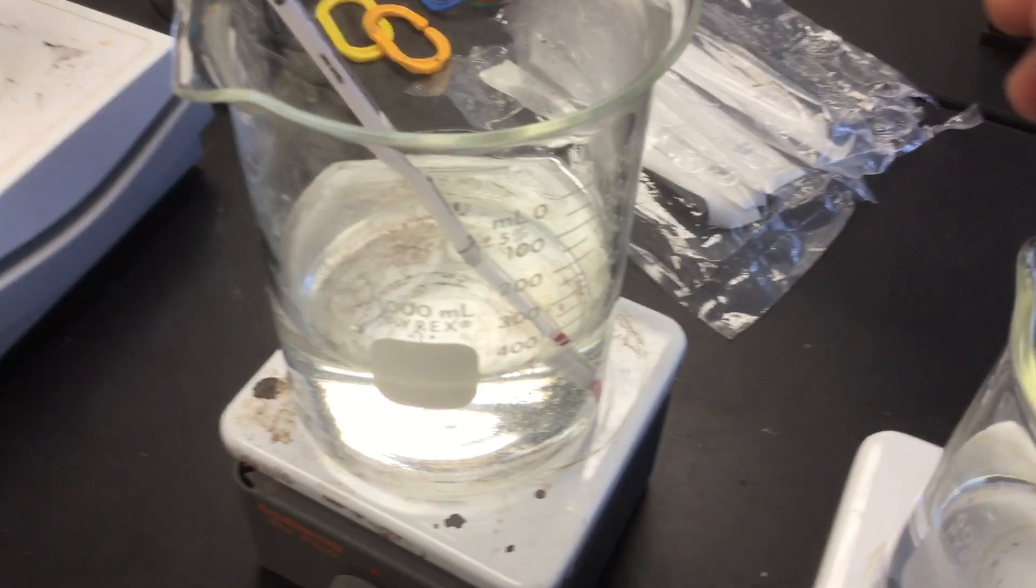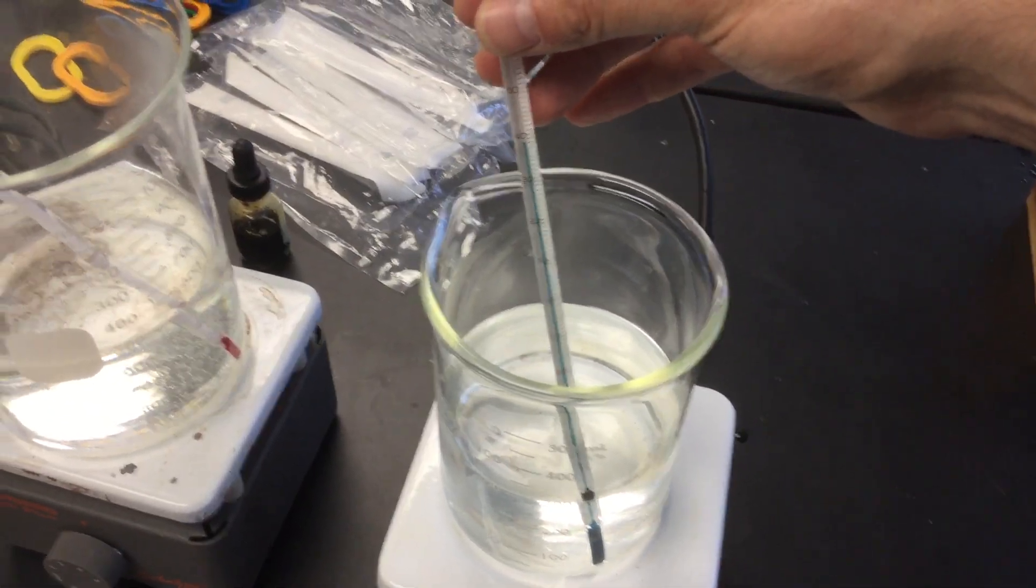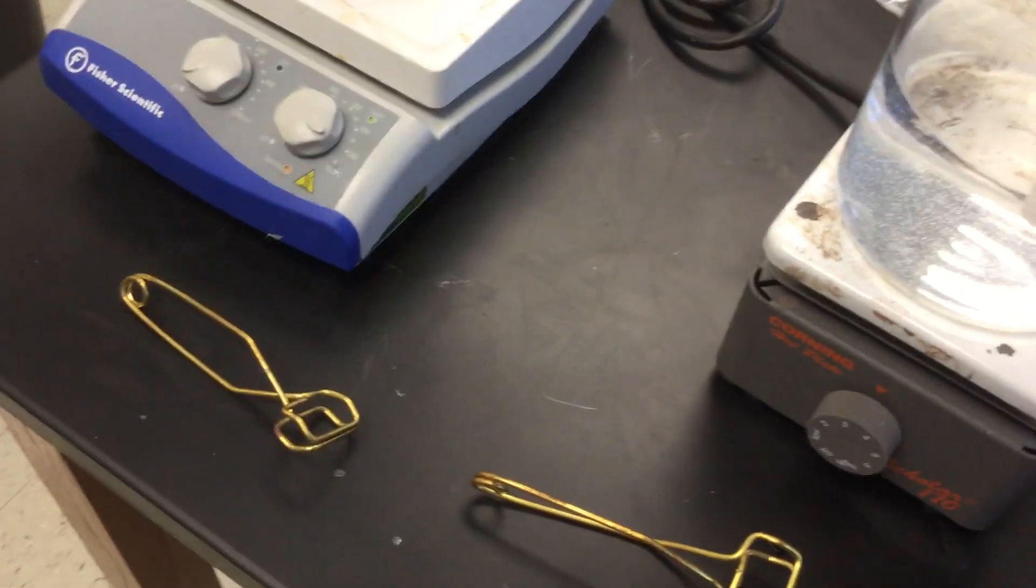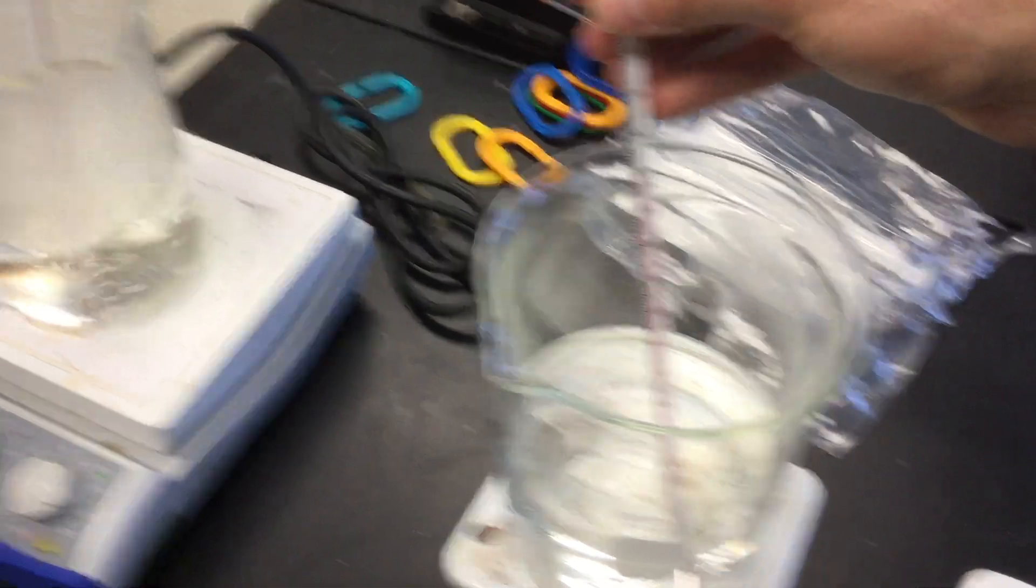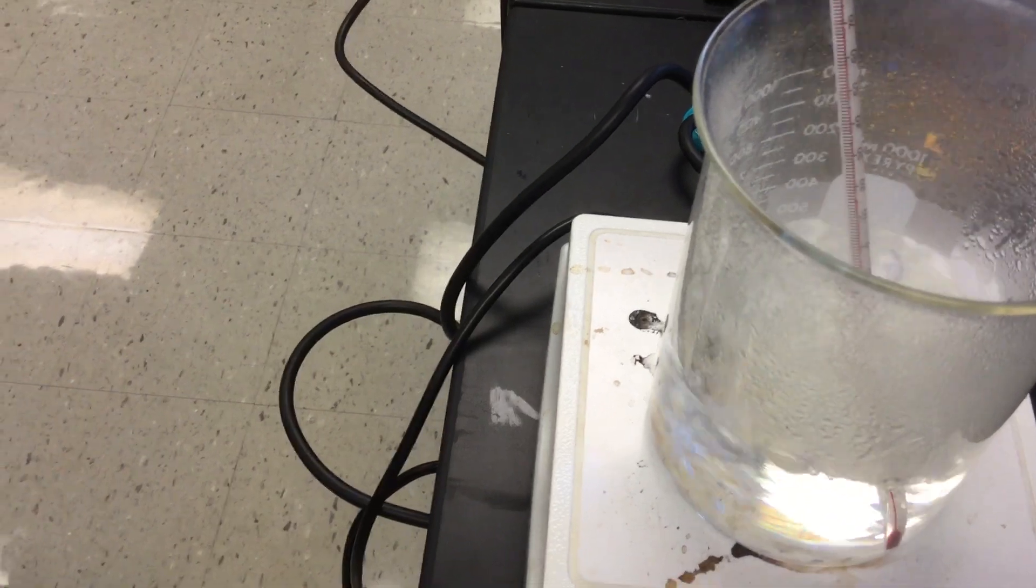This is body temperature, which is 37 degrees Celsius. This is hot, like feverish, like 50 degrees Celsius. And this is clearly boiling, which is 100 degrees Celsius.